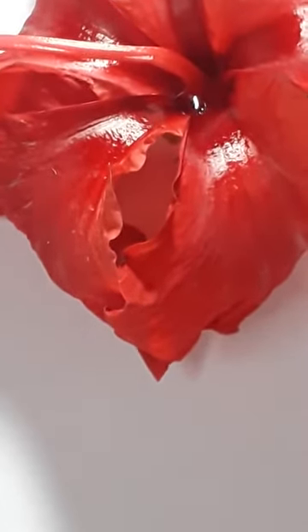Today we are going to perform an activity in which we dissect and observe the parts of a flower, right? For this experiment I have chosen the hibiscus flower. In this hibiscus flower we are going to observe all the reproductive parts. As you know, a flower has four whorls, and in these four whorls the flower has its male and female reproductive organs. So let us start with our activity.